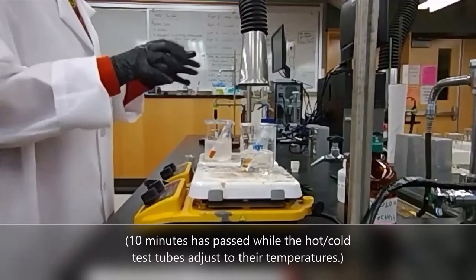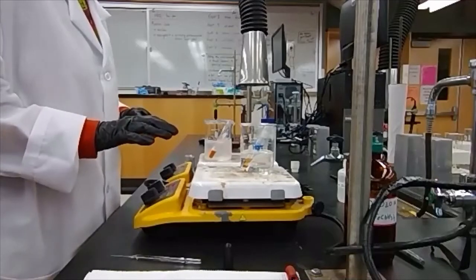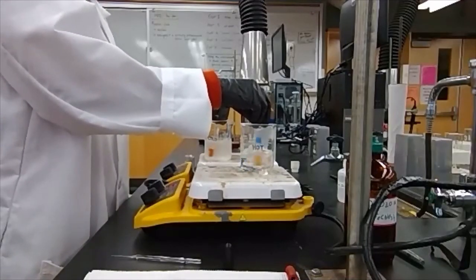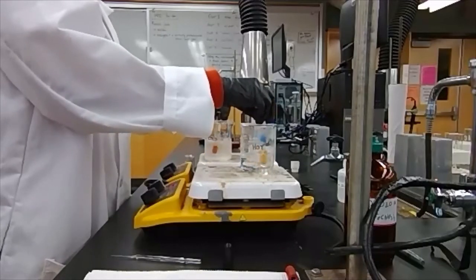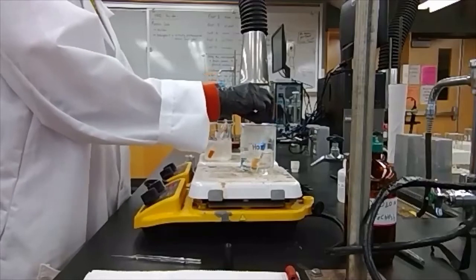Okay, we are back. We're now looking at the hot and cold test tubes of our equilibrium reaction. And so as you can see, there's a little bit of difference in intensity in the color.